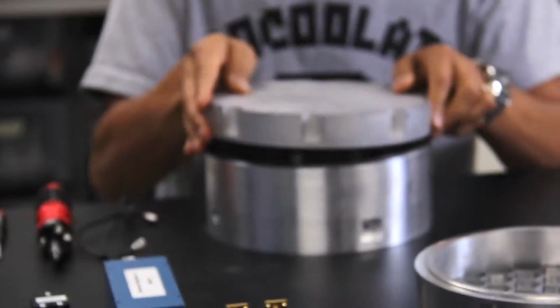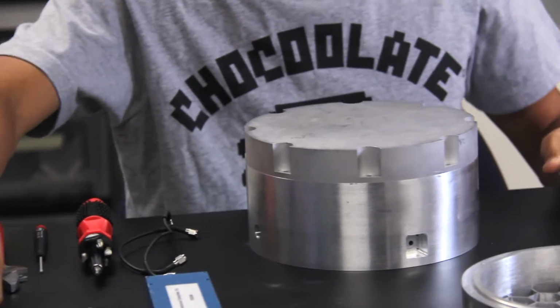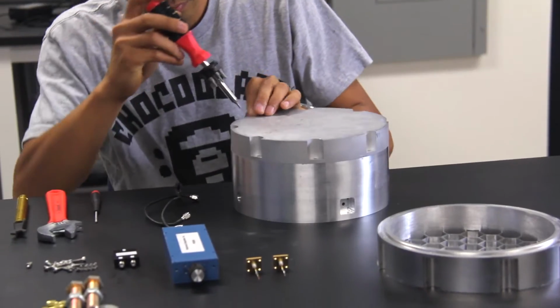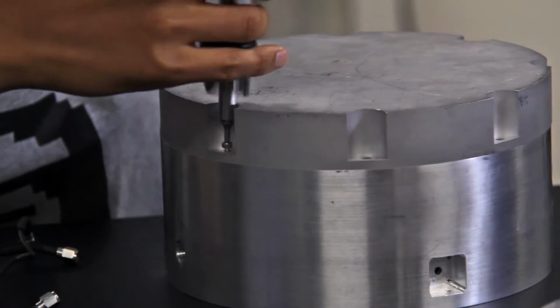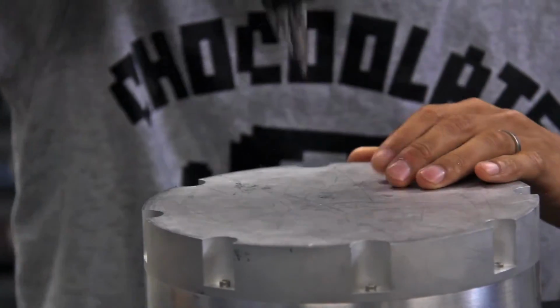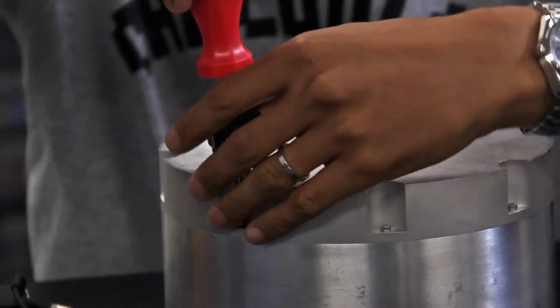To make the cavity, the contact between the different layers is very important because there's a current leakage which makes the cavity's efficiency drop. So make sure you tighten the screws. To tighten up each of the layers, you have to screw in a cross formation, something like this.